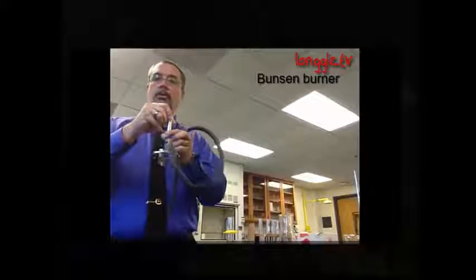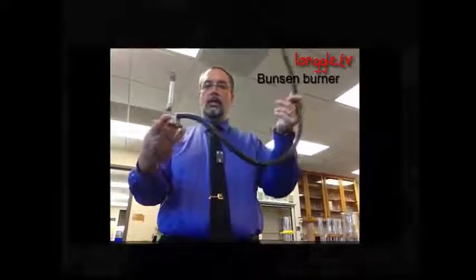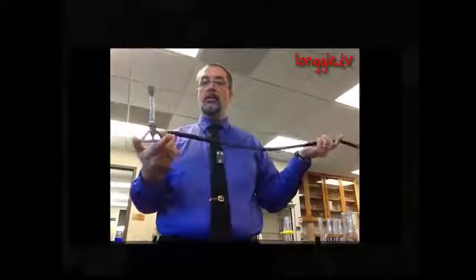So we can heat liquids in beakers, we can heat solids in crucibles, we can do chemical reactions in test tubes or in Erlenmeyer flasks. What if we want to heat something? We keep talking about heating things. How do we heat things? Well, we're going to use something called a Bunsen burner. Here's a Bunsen burner, a very famous structure here in chemistry. We use these Bunsen burners to heat things all the time.